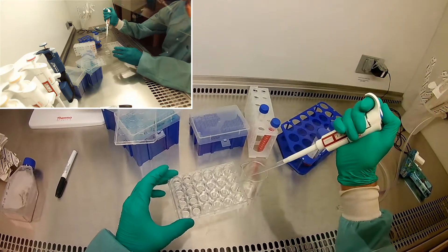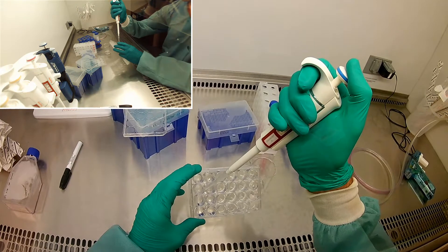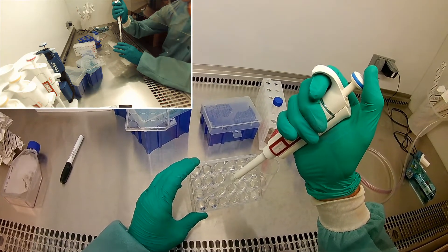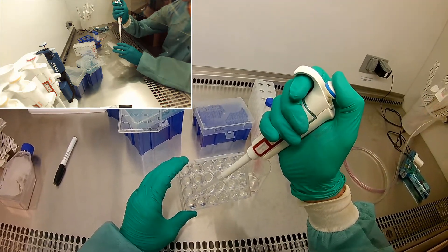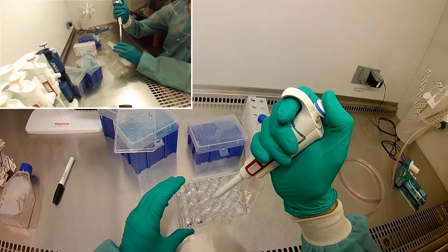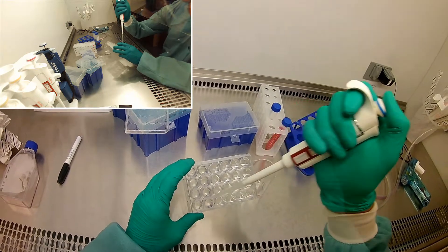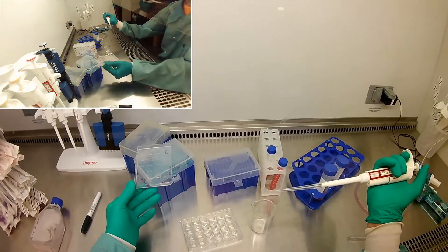Even tilting. Okay, I think we got that done pretty good. By tilting, I can get all the liquid down into a corner and have the best chance of sucking it. So I got more than one mil in this well. I have to be careful not to touch the hydrogel. And if you were going with this aspirator, it would be very impossible. So now I'm going to go ahead and change tips.